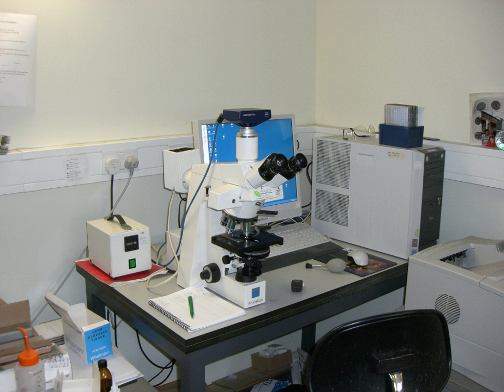The eyepiece, or ocular lens, is a cylinder containing two or more lenses; its function is to bring the image into focus for the eye. The eyepiece is inserted into the top end of the body tube. Eyepieces are interchangeable and many different eyepieces can be inserted with different degrees of magnification. Typical magnification values for eyepieces include 5×, 10× (the most common), 15×, and 20×. In some high-performance microscopes, the optical configuration of the objective lens and eyepiece are matched to give the best possible optical performance, most commonly with apochromatic objectives.